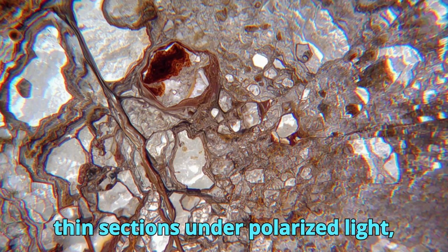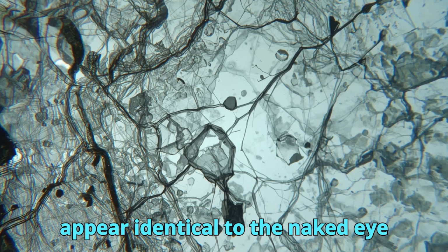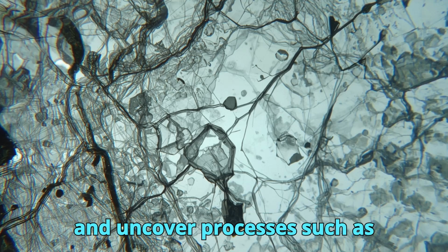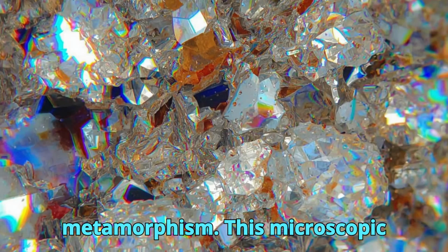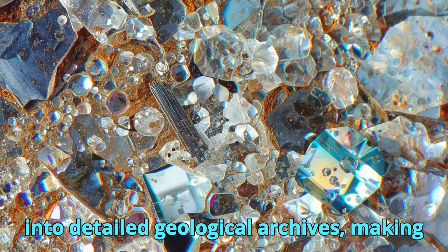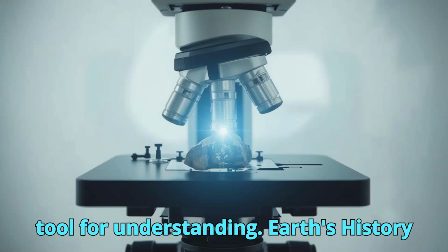By examining thin sections under polarized light, geologists can distinguish minerals that appear identical to the naked eye and uncover processes such as crystallization, deformation, and metamorphism. This microscopic perspective transforms ordinary rocks into detailed geological archives, making petrographic identification an essential tool for understanding Earth's history.